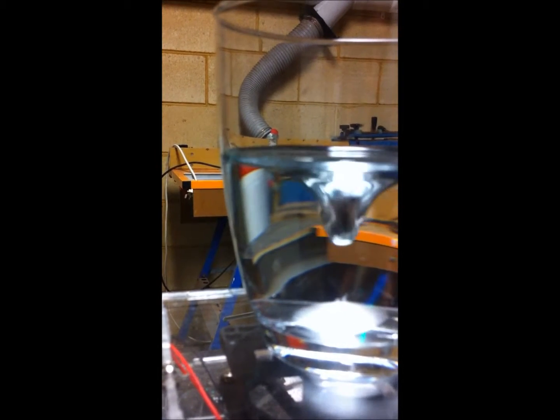Okay, maximum speed however is really quite impressive. You'll get a reasonable sort of vortex on there before eventually the bead loses it through to turbulence. But you've got quite a good range of things.